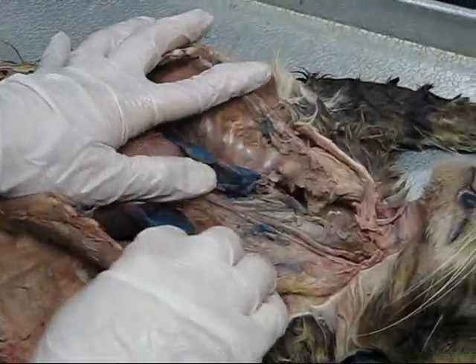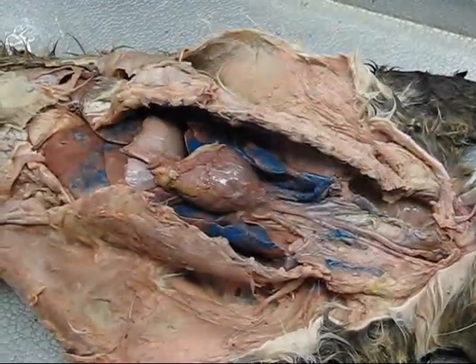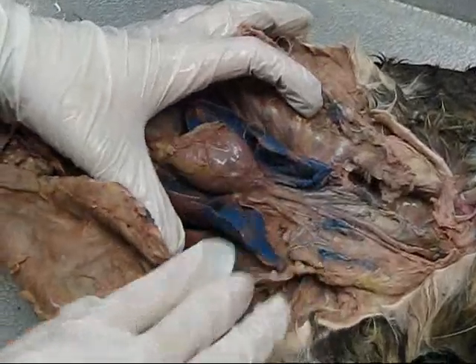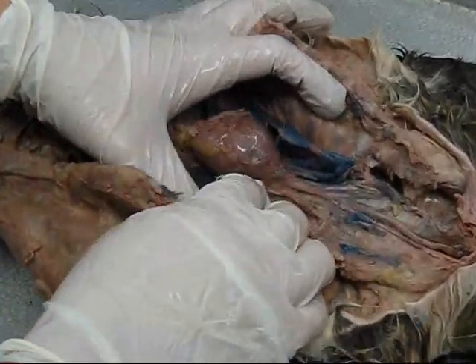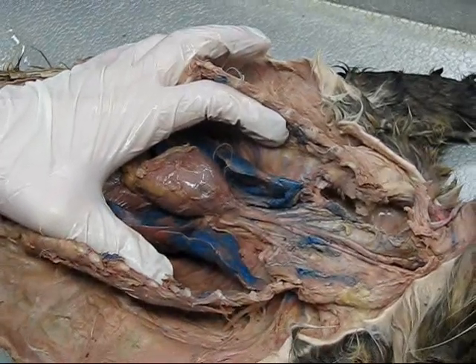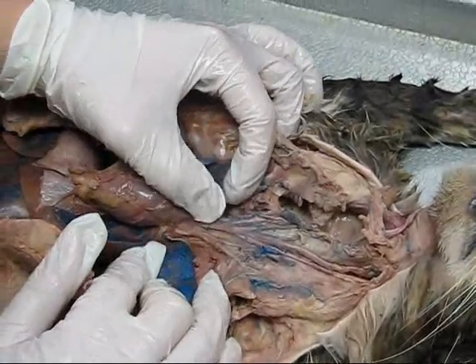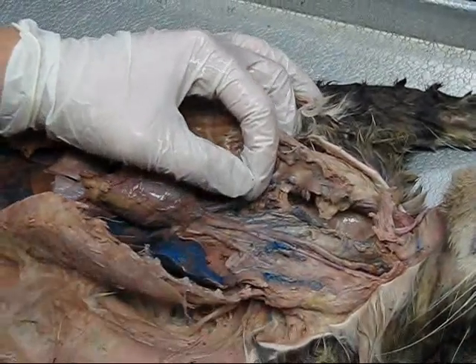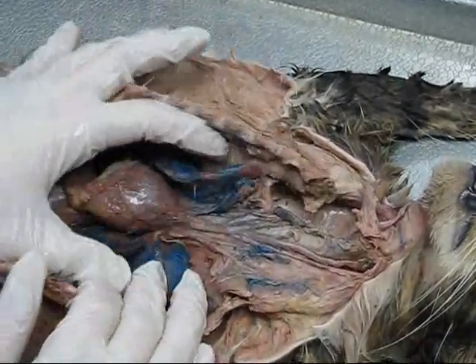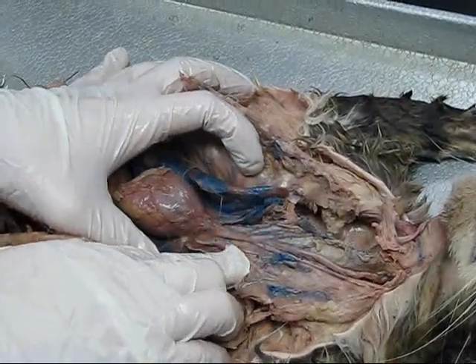It's always a little hard to see. But where we had the brachiocephalic branch off at the same point like a Y in the veins — they don't do that in the arteries. The first one off the thoracic aorta is going to come off toward the bottom. And you only have one brachiocephalic — you don't have a left and a right, just one. The brachiocephalic comes up through here. Coming off the aortic arch you only have two things: the brachiocephalic at the top, and then the left subclavian, which comes off here off of the aorta.